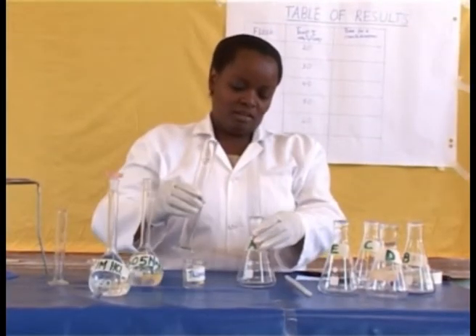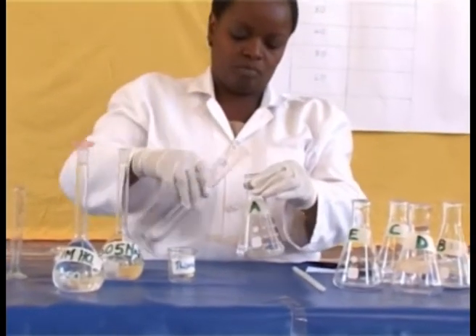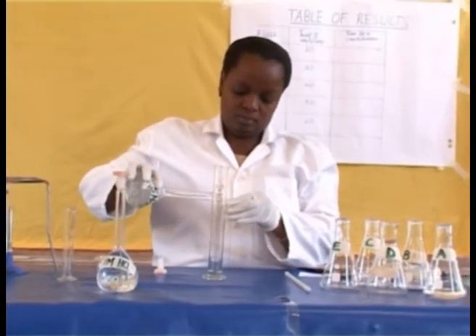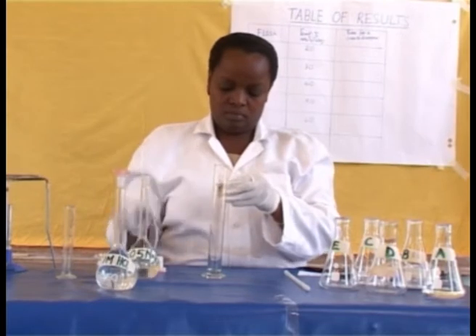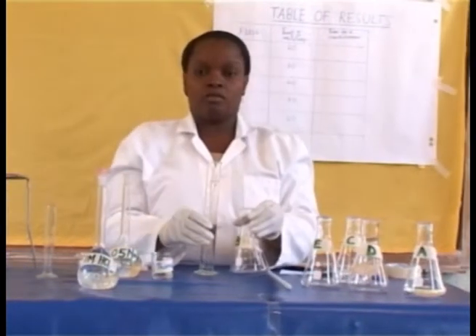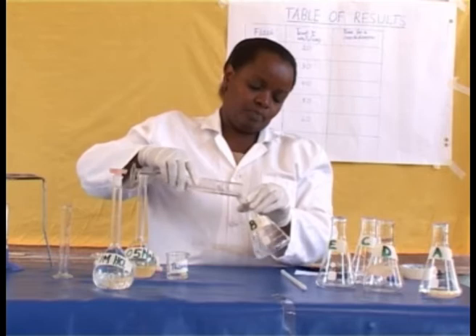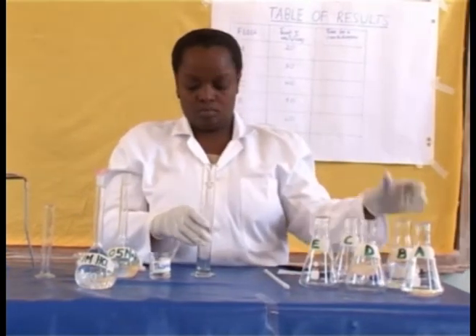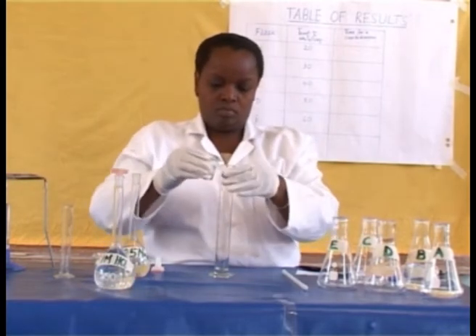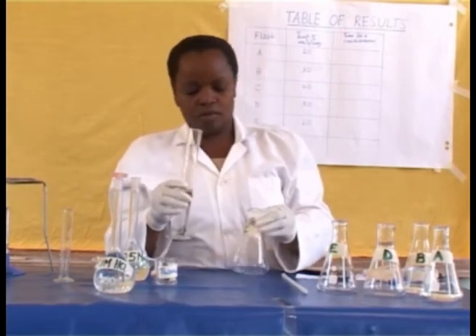Measure 50 milliliters of sodium thiosulfate solution into each of the five flasks. Transfer the sodium thiosulfate solution into conical flasks A, B, and C.